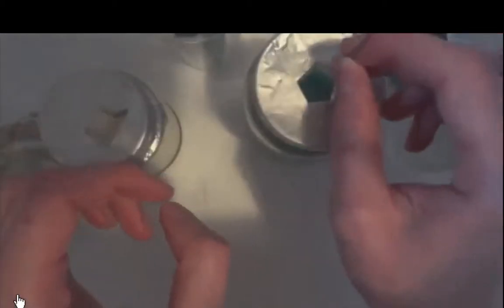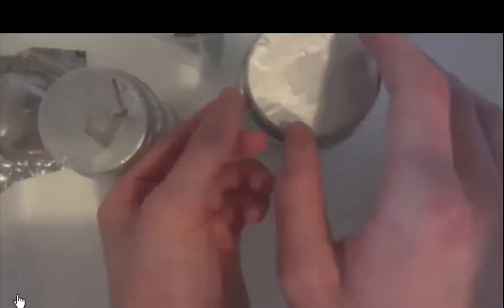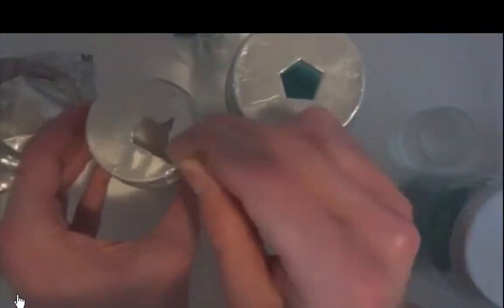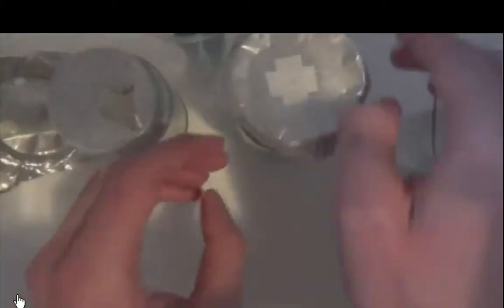Now, I completely forgot to get any pictures of these finished agar plates. I had quite a bad cold, so this is once they've colonized, I'm then transferring them another generation onto some lovely blue agar that I made. This is me just cutting a small chunk out of a colonized plate and dropping it back onto some blue agar. This is made by the exact same recipe.